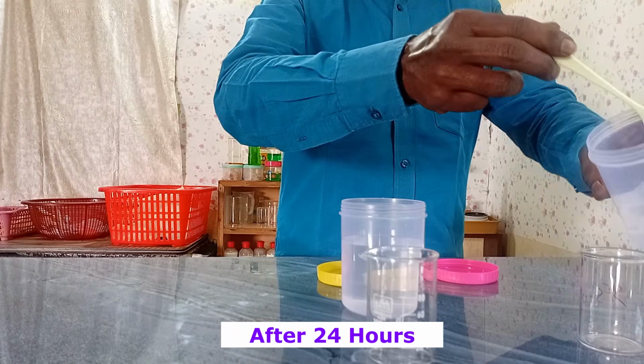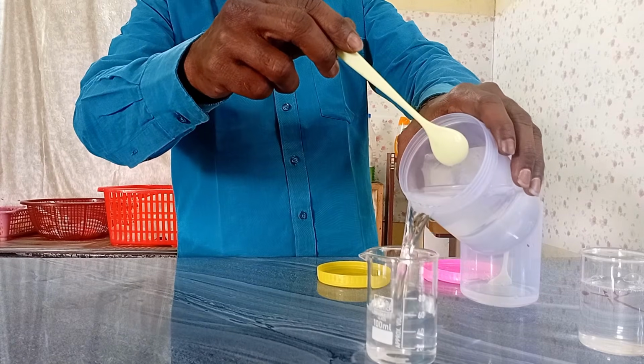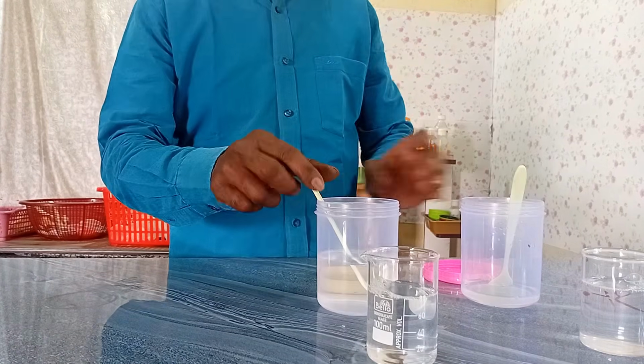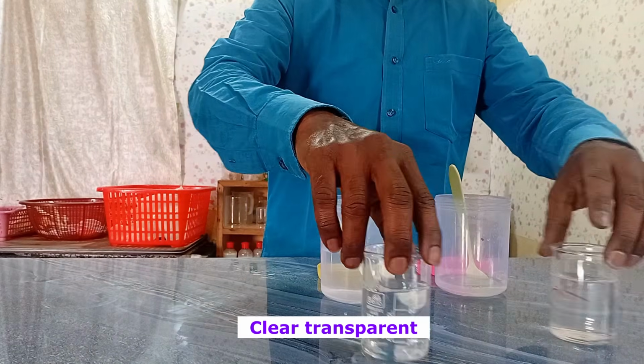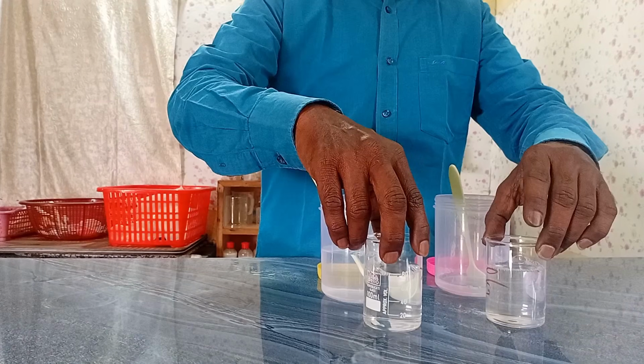This is the next day. Both 100 ml and 200 ml water are having a clear homogeneous medium. So the point is, we can directly incorporate SLES paste in our process, without hot condition also, with normal blending. I am not getting turbidity.